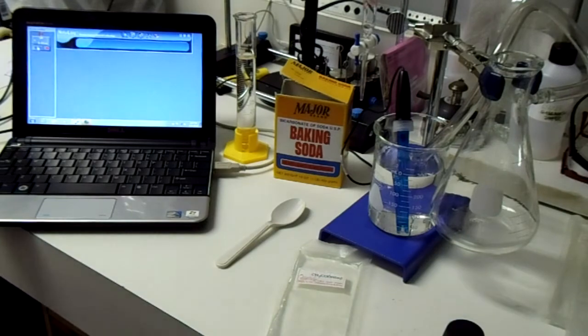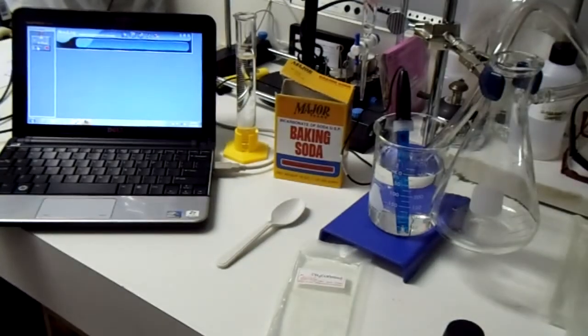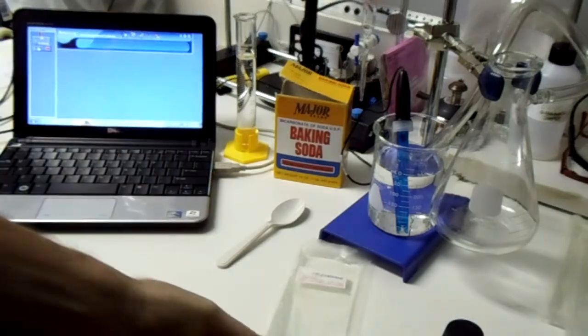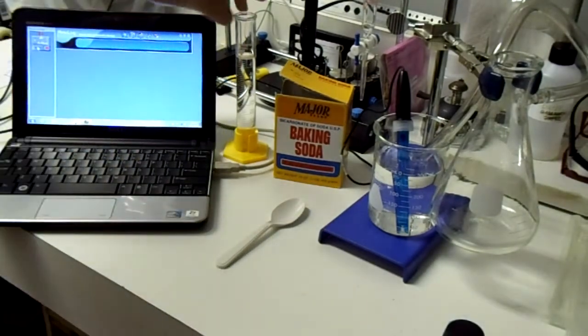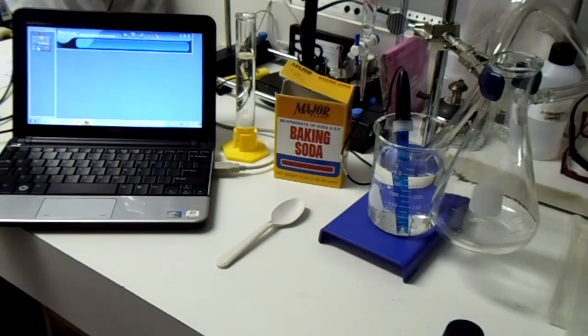By doing a very simple experiment, something familiar with maybe early learner chemistry, and that is taking sodium bicarbonate or baking soda and combining that with vinegar here. Taking our packet here, cutting it open and measuring about 50 mils of vinegar, that I will pour into a flask a little bit later.